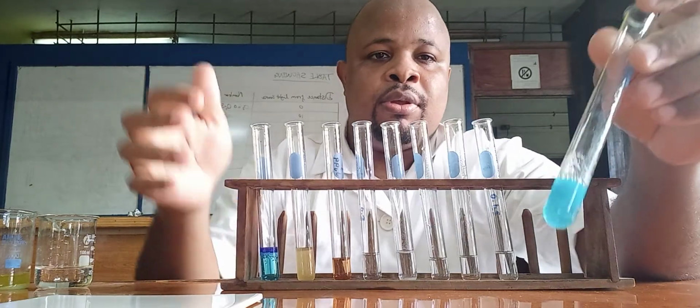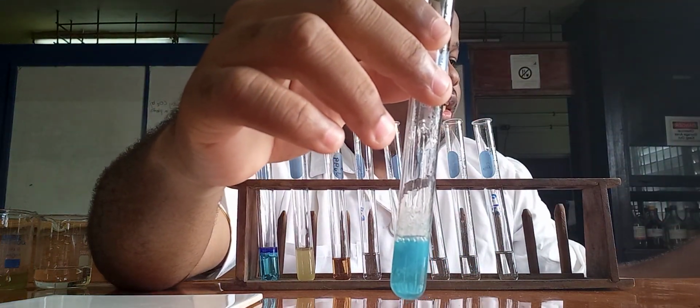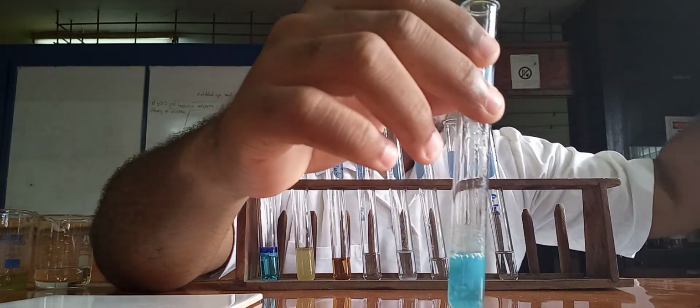Now, let me add the sodium hydroxide in excess. Alright.